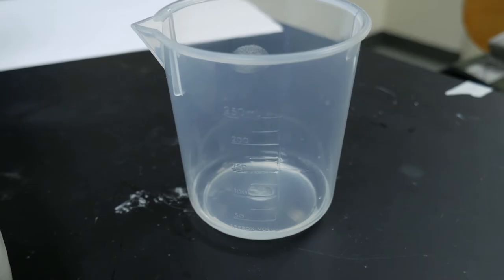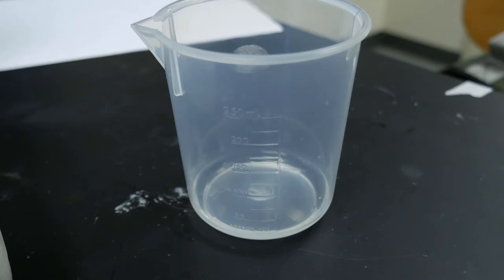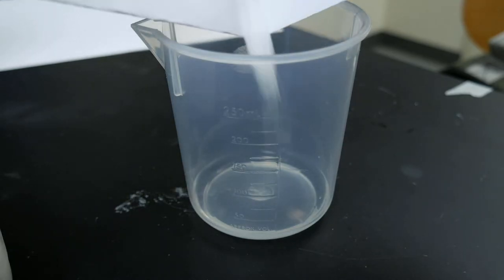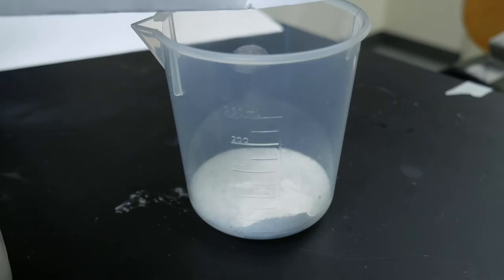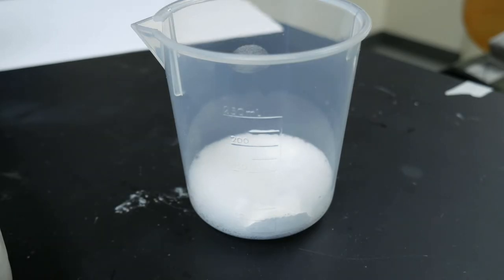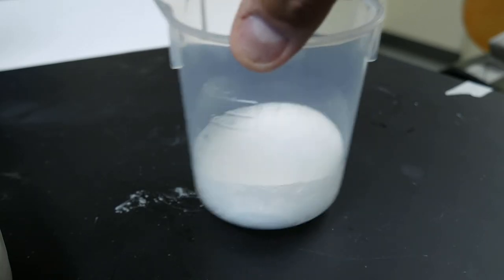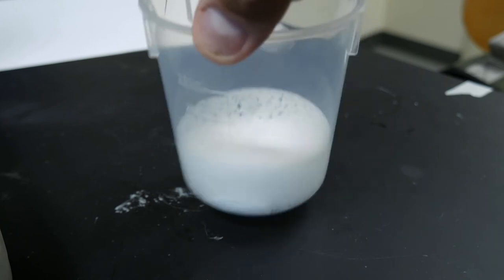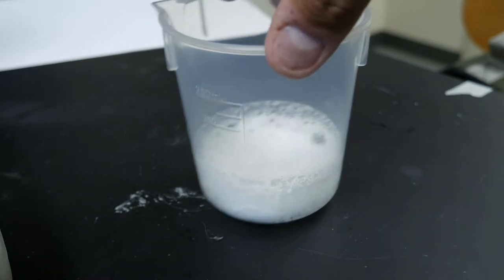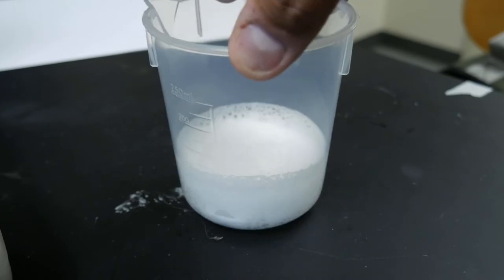We're going to carefully pour the baking soda into the beaker with the vinegar, allow the reaction to occur, and then record the mass of the products when the reaction is over. Let's give it a bit of a swirl to make sure that all of it is reacting so we don't have anything left over. Some of that baking soda likes to cake onto the side of the beaker.